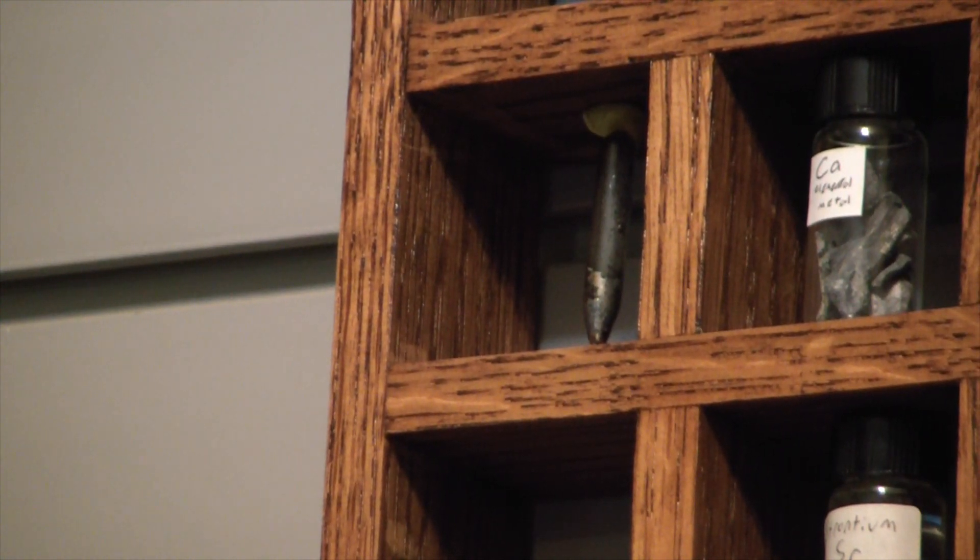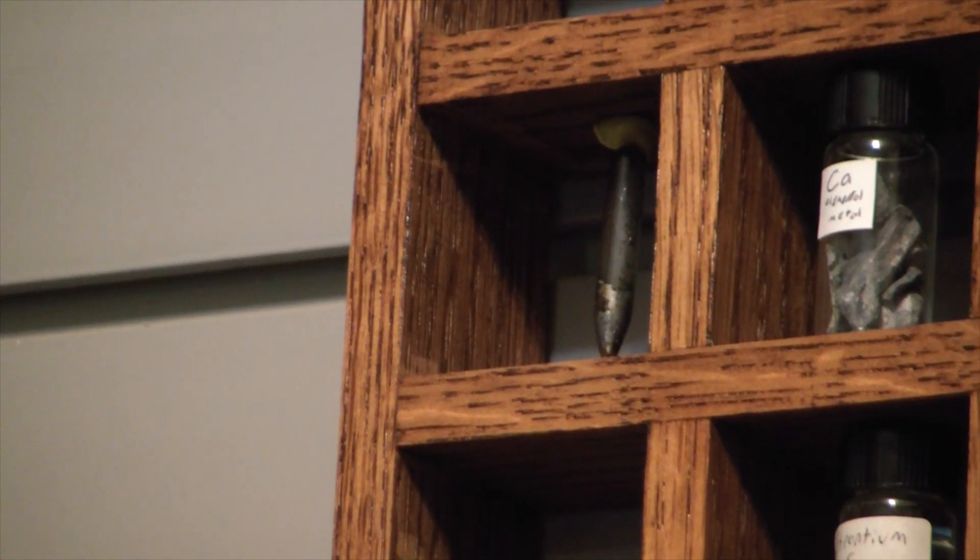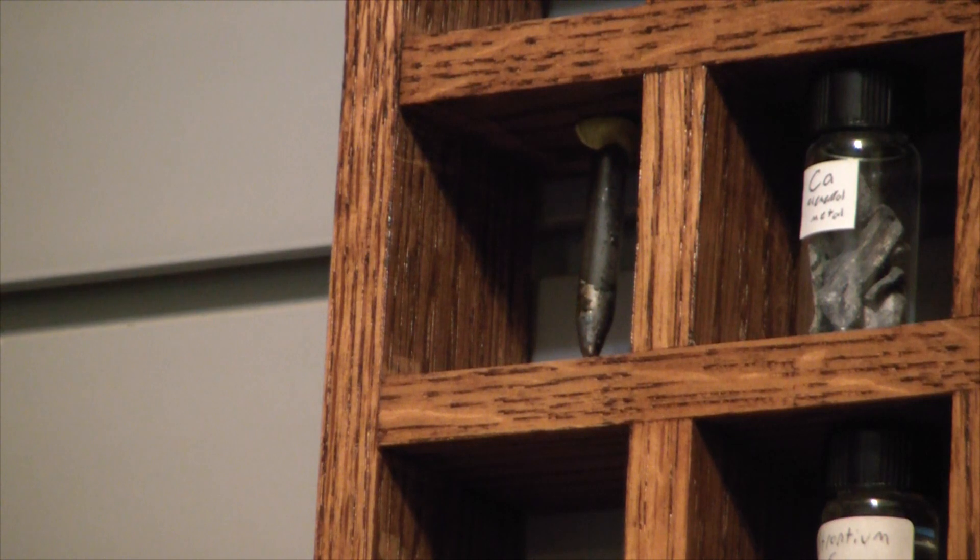You can see there, it's just kind of ampuled, a little bit ugly, highly oxidized. Was not my best work, it is potassium, it still counts. But I want to revisit it, get a larger sample.